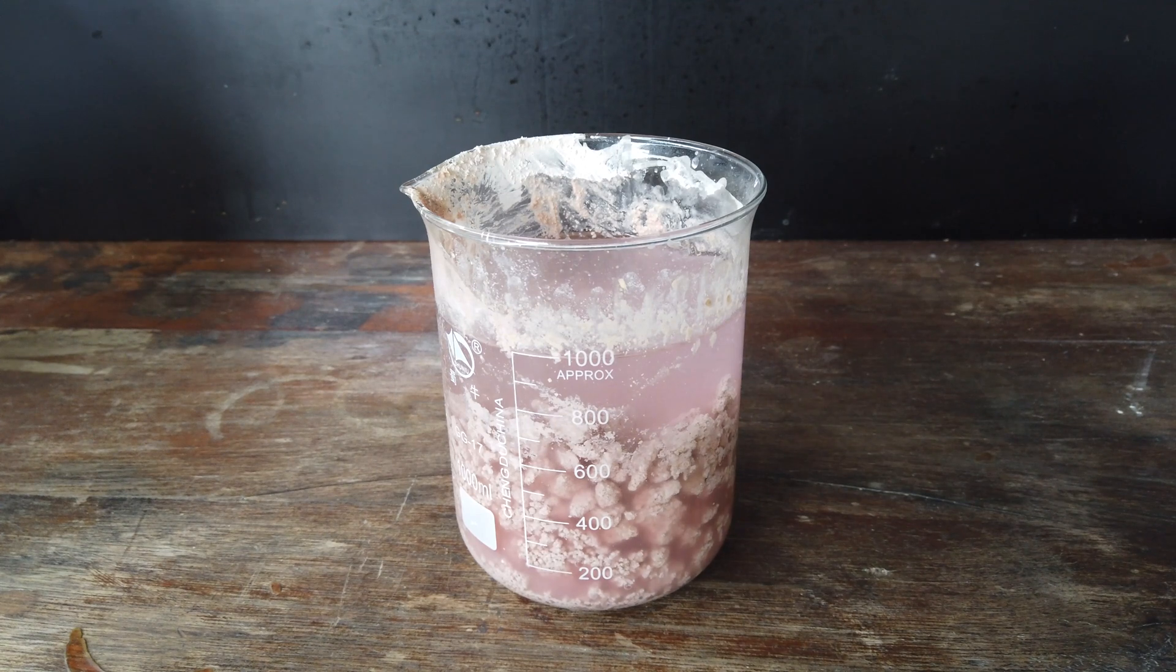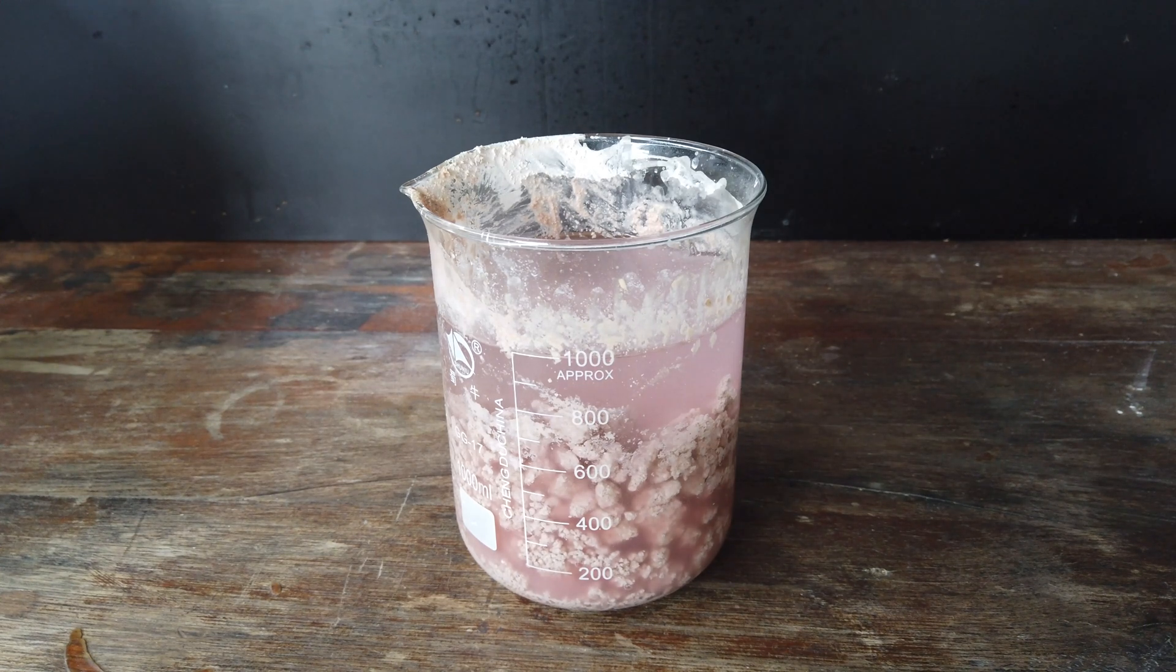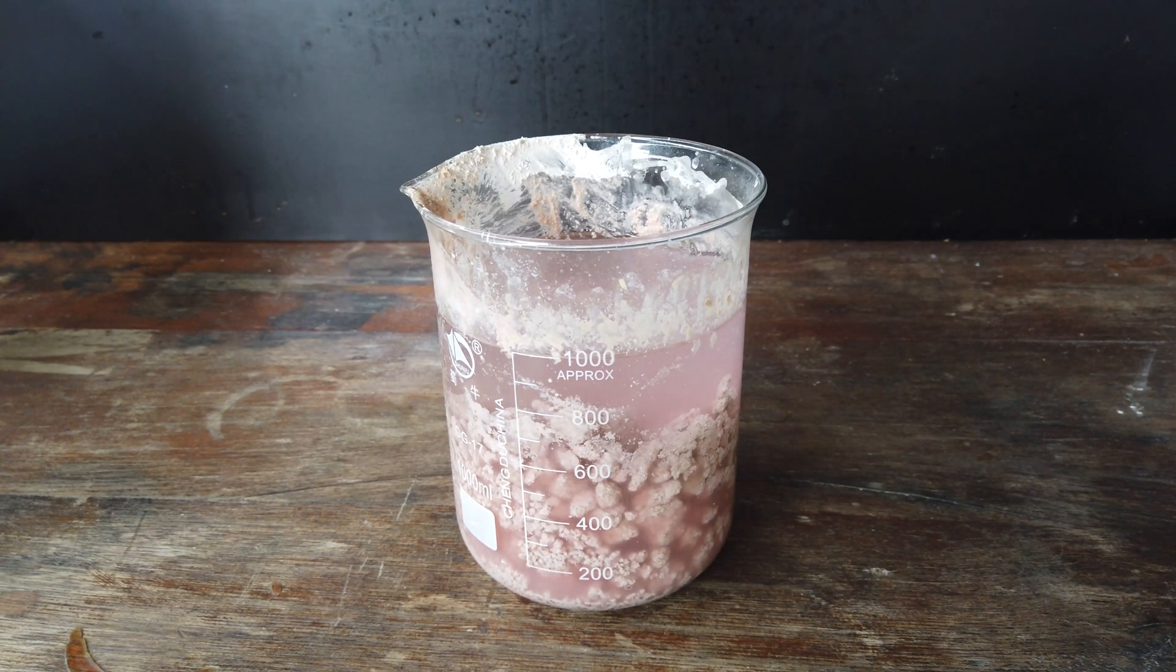We determined that this was the reason our electrolysis procedure didn't work out in the previous video. Our solution was just too acidic. I'm going to go ahead and allow the sulfuric acid to dissolve as much of that precipitate as possible. And then I'm going to start electrolysis.